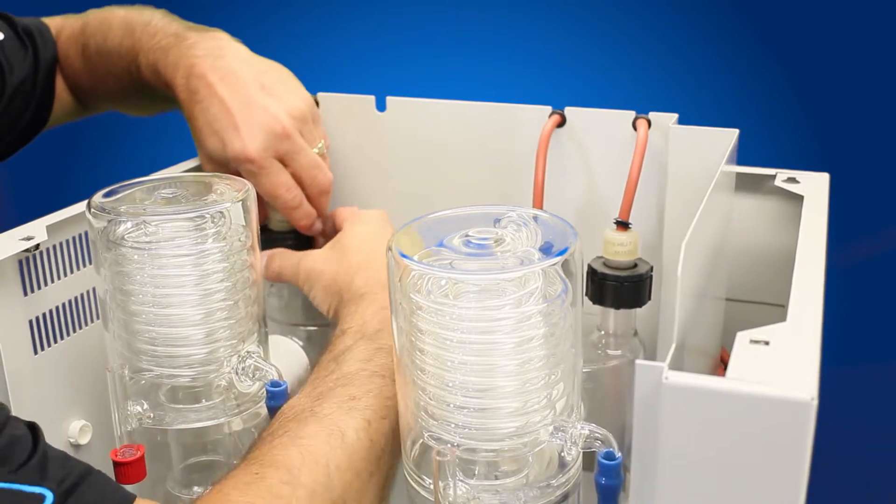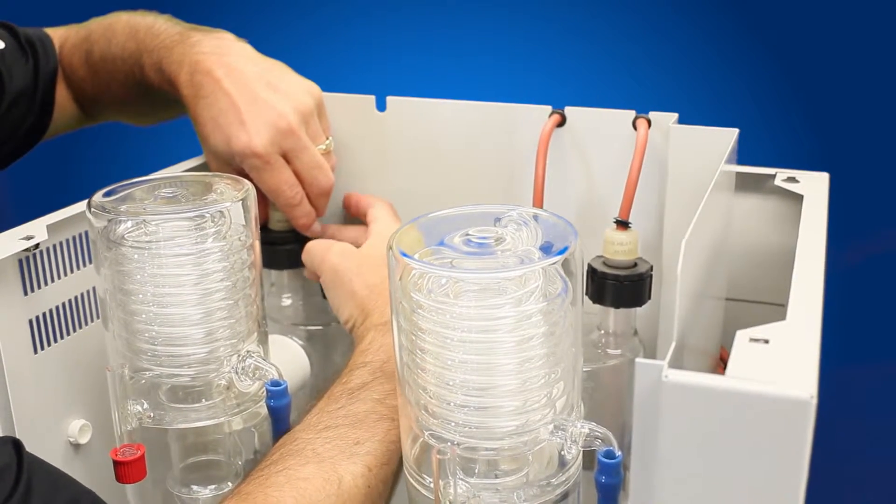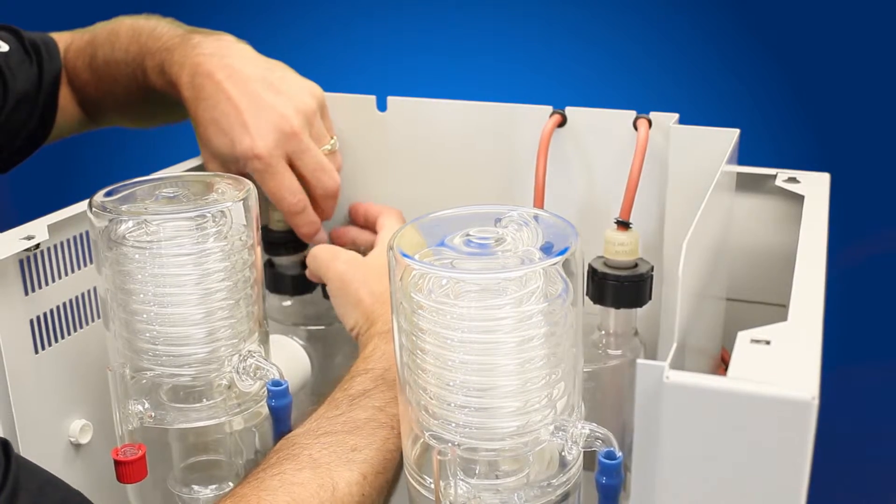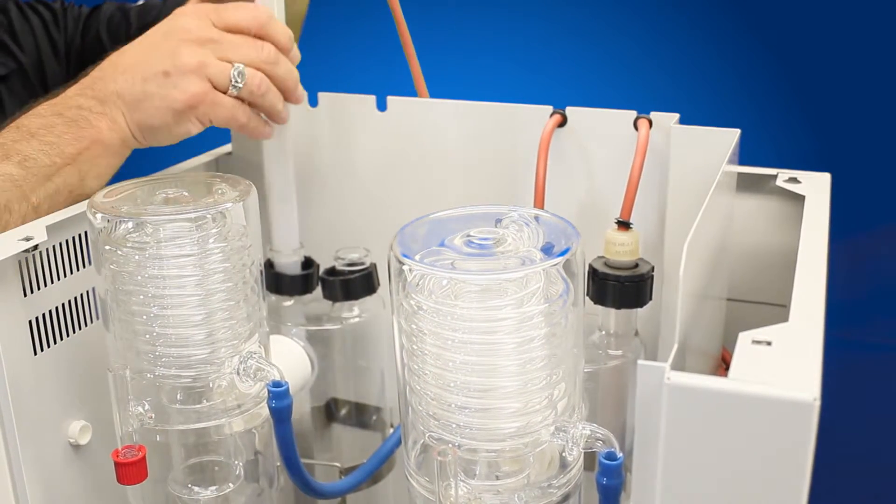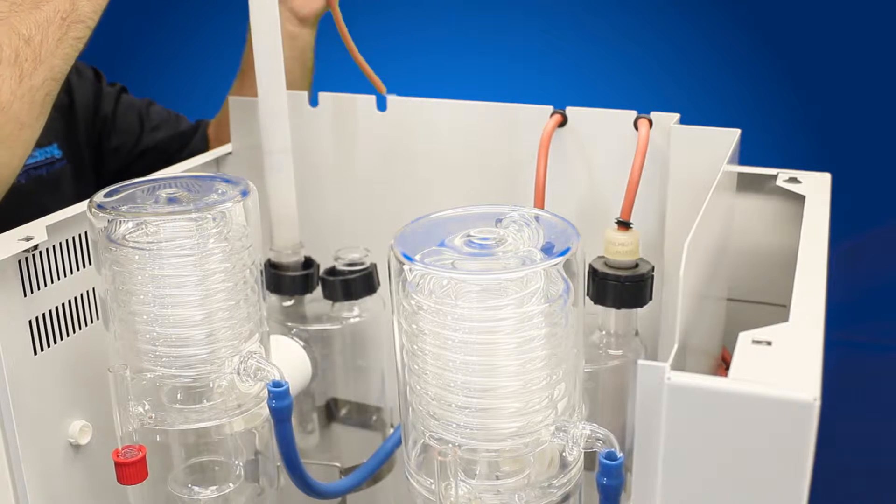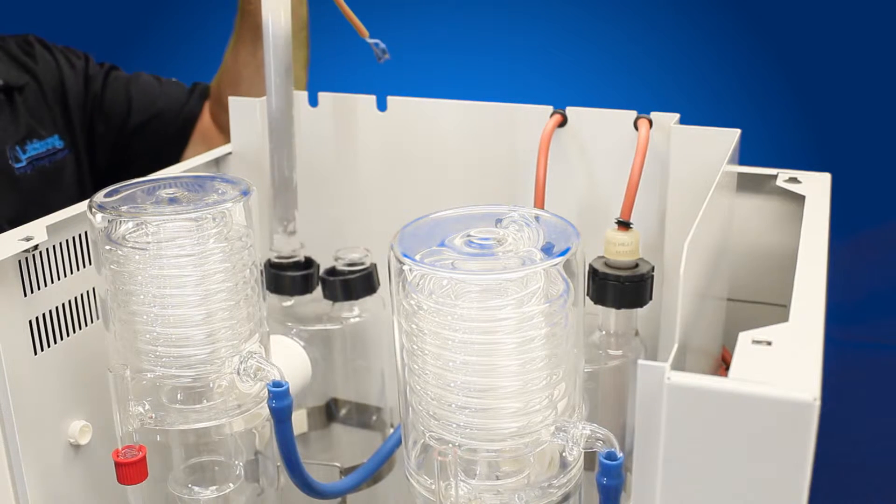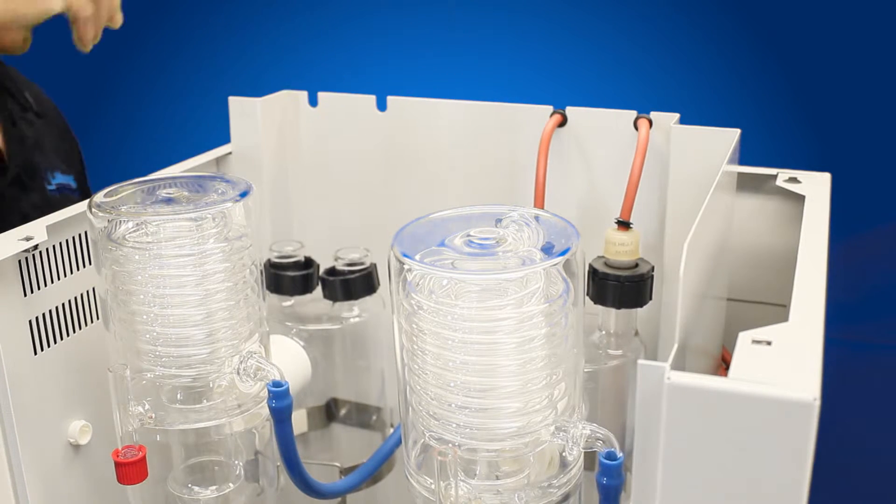Take our second element, take the split ring apart. Pull the element up. This one's already disconnected from the relay. Pull that out. Now you've got your elements removed.